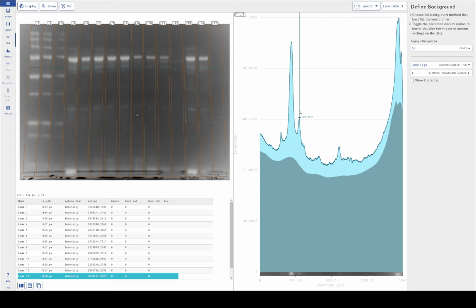So by using lane edge, what we actually do is look outside the lane box, look at the pixels along the edge of the outside of the lane box, and use the average value there as the background subtraction technique. So you can see that it is somewhat adaptive, but also it is somewhat niche in its usage. This is a good example because it's quite a busy lane, but it would be even more useful with more densely populated lanes than this, to get accurate background subtraction. And of course, we do have the option to influence that with the smoothing radius, again, based on lane percentage, to how we want to adjust that. And you can see all that adjusting in real time.